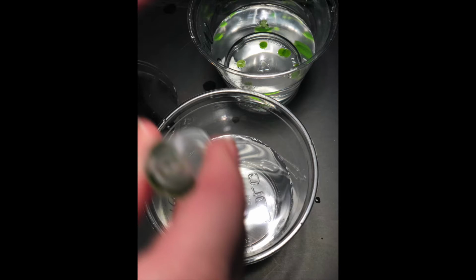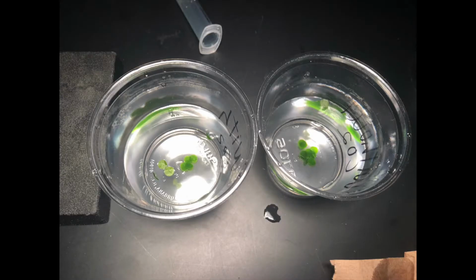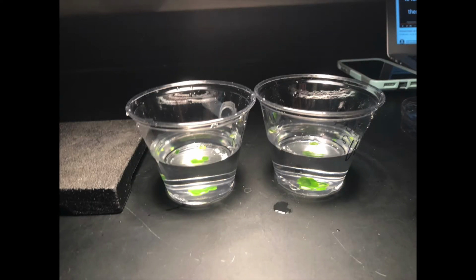One may ask, what was the purpose of creating a vacuum with the syringe? Well, the leaf discs normally will naturally float. However, the vacuum causes the air spaces in the leaf discs to be filled because it takes the air out of the leaves. As water fills the leaves, the density increases and the leaf sinks in the syringe. We also remove the air from the leaf disc's central vacuole, and it was being replaced with water. For this procedure, we wanted the discs to sink because once placed under the light and in the bicarbonate solution, we can tell the process of photosynthesis is taking place as the discs rise.